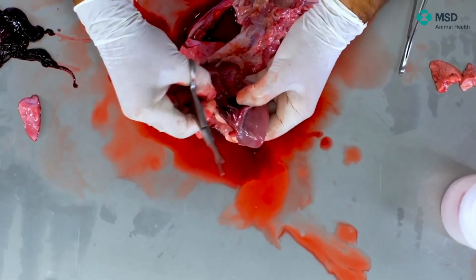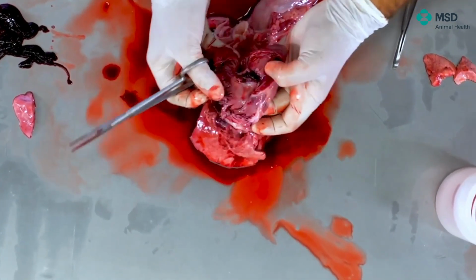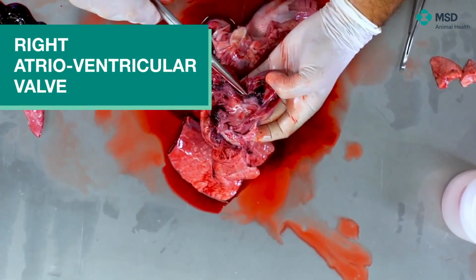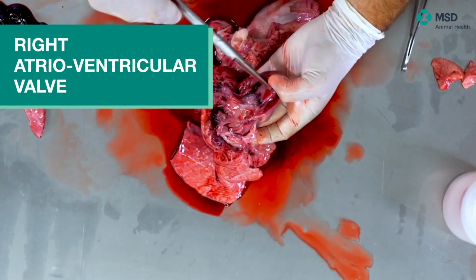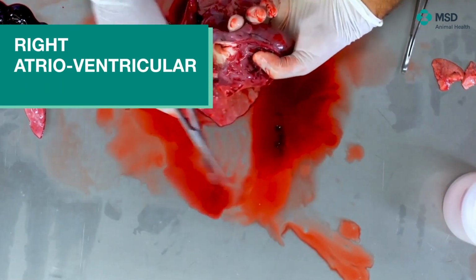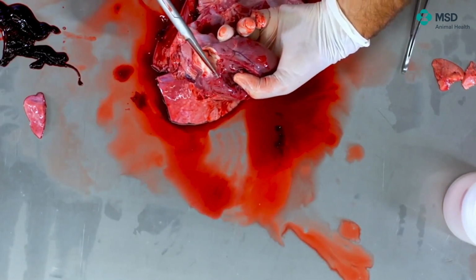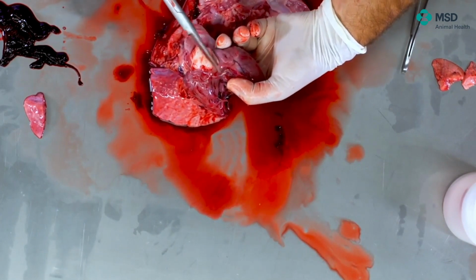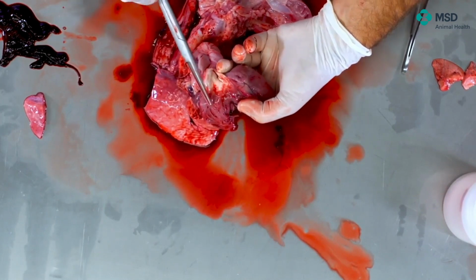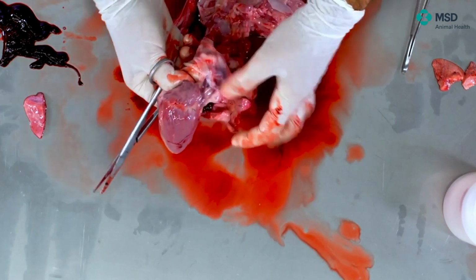And the most important visualization here is the atrioventricular valves, you can see here, and also the valves of the aortic, the pulmonary artery, as you can see here. Okay, this looks normal, and then we will do exactly the same with the left heart.